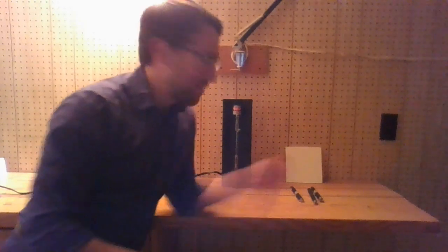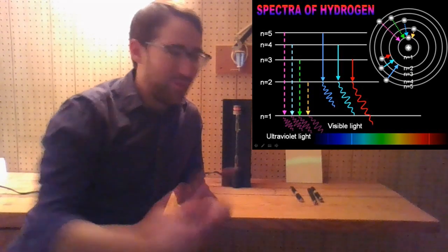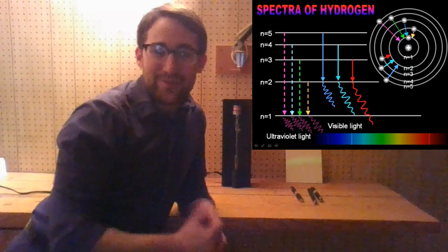So if I beam this with the ultraviolet light, we get light back out. Now, this doesn't shine purple — it shines green, which is a little weird. I put energy in, and energy comes back out. The energy, the light that comes out of these electrons as they de-excite from the excited state back to the ground state has to do with how far out they went and how far back they go when they return. More energy means they move farther out, which means they jump back farther, which means the energy of light they release is higher.